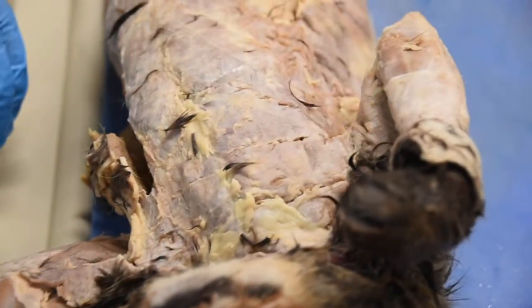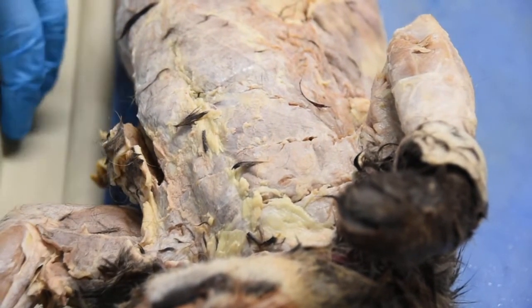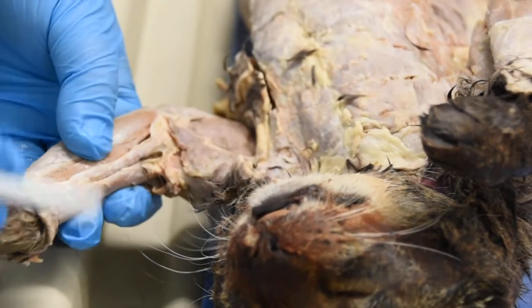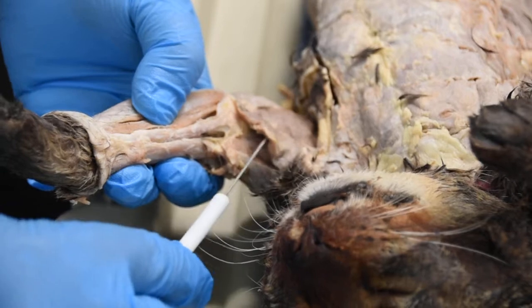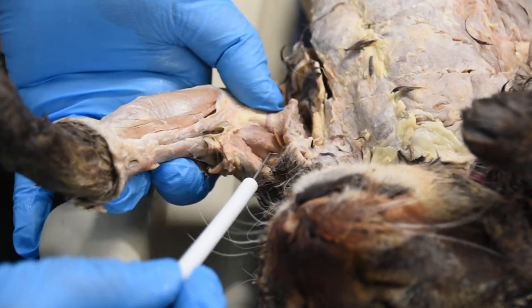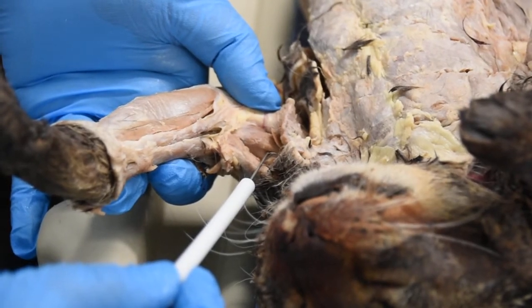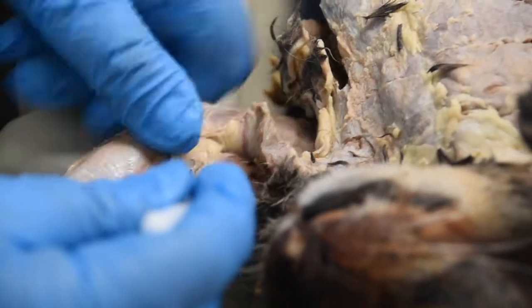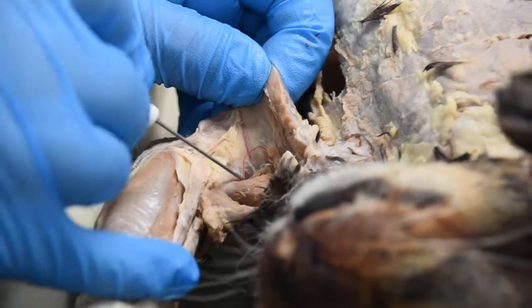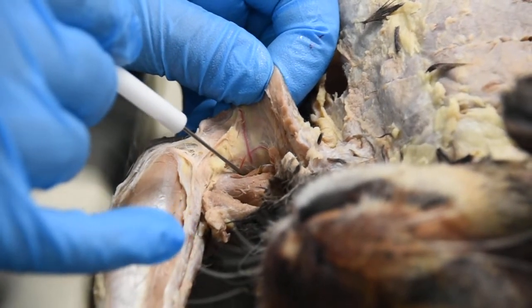Some of the other muscles I want to point out in the arm and the neck for you guys: when we take a look at your arm muscle, right here on top of your shoulder, underneath your clavodeltoid, you can see this muscle right here, which is going to be your biceps brachii. And then underneath the biceps brachii, and I don't know if you guys can see that very clearly, right here would be your brachialis muscle.